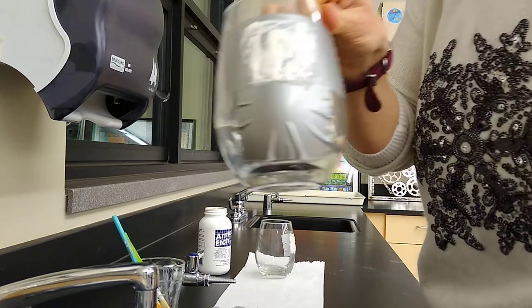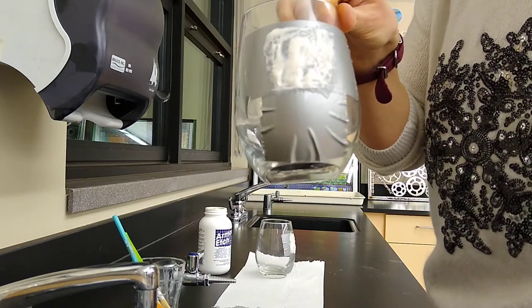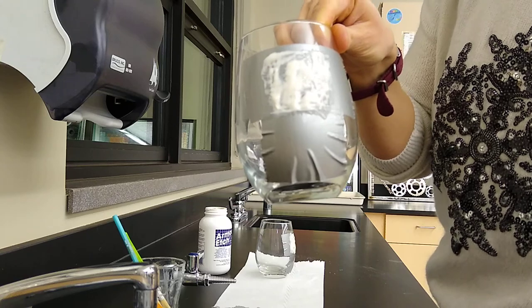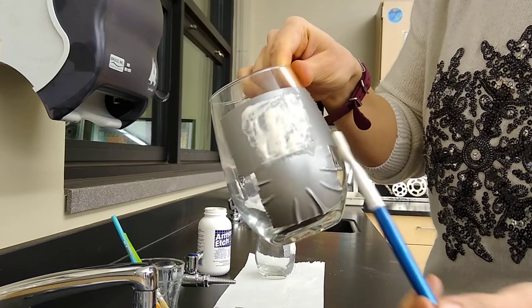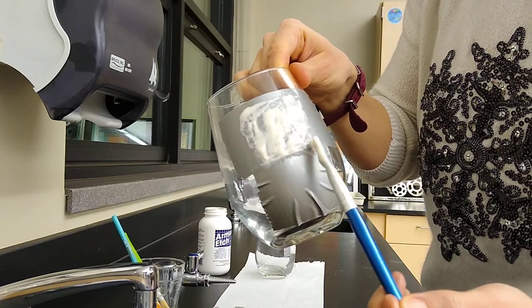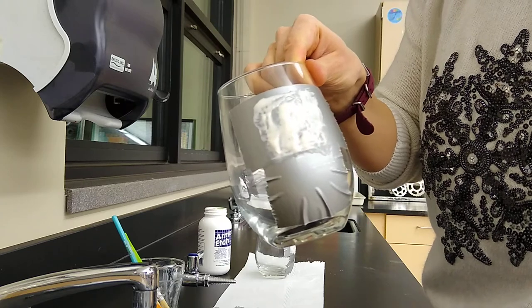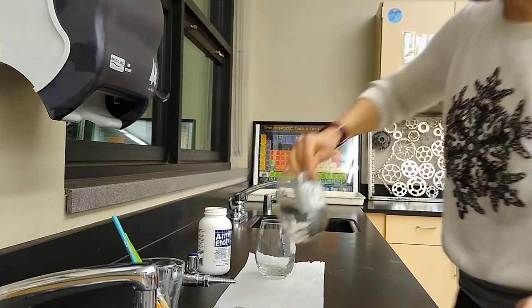When you've got that done, you can see here it's kind of a thick layer. It's not super globby thick, but it's thick enough that we can't really see through it and all of the design is covered there.